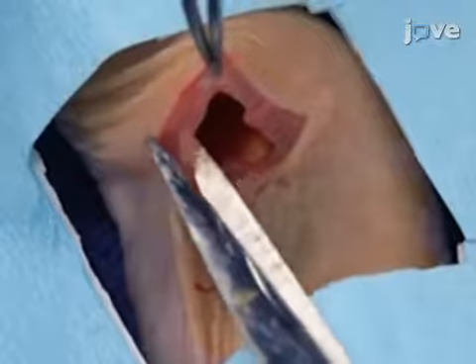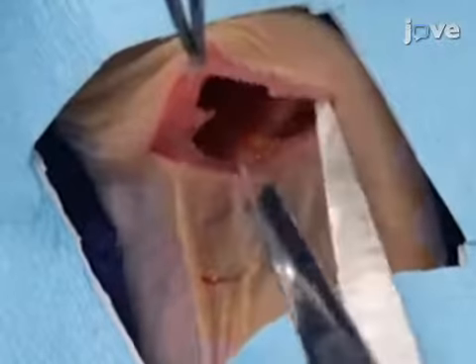The steps demonstrated for injection are critical for the procedure. Leakage of tumor cells during injection can lead to extrahepatic metastases. Injection should be performed slowly, over 30 to 60 seconds, with no more than 1.5 million cells to prevent portal venous thrombosis.